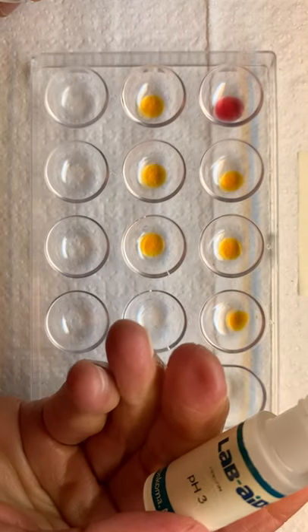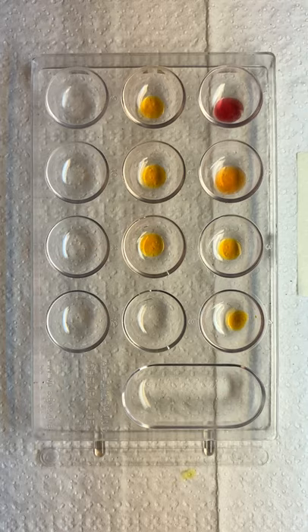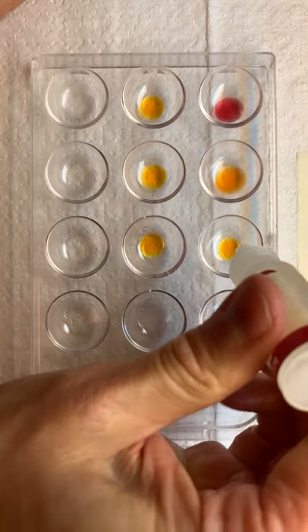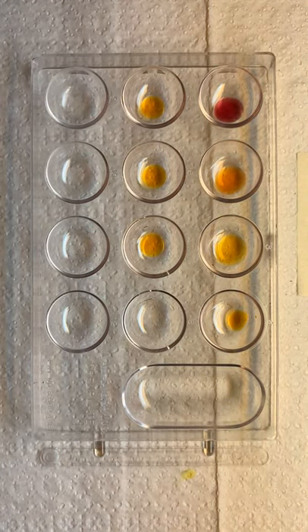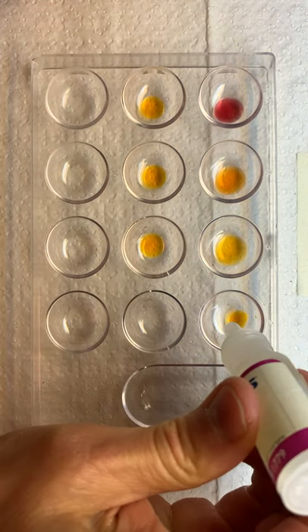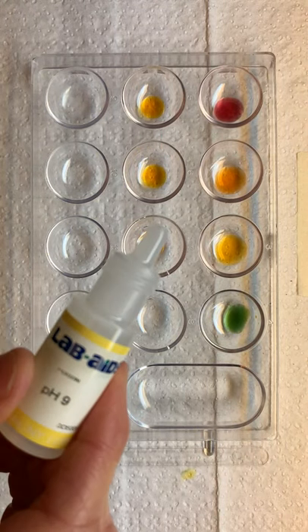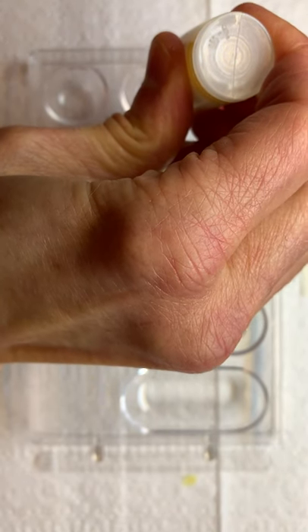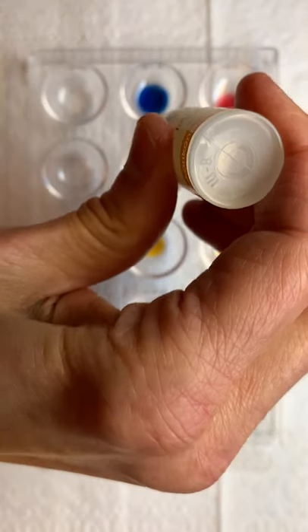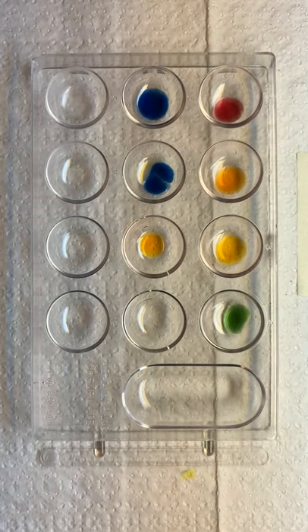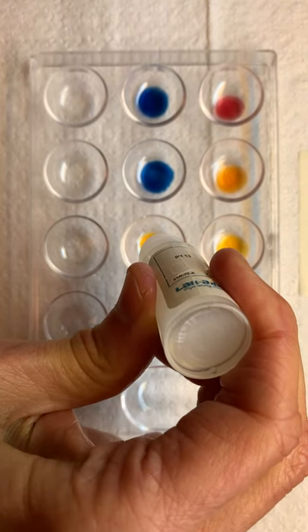pH 3. pH 5. pH 7. pH 9. pH 11. pH 13. Last one, here we go.